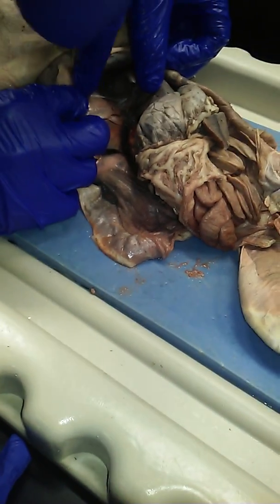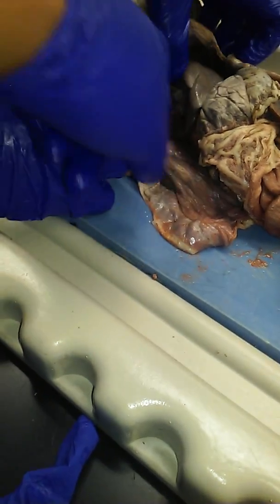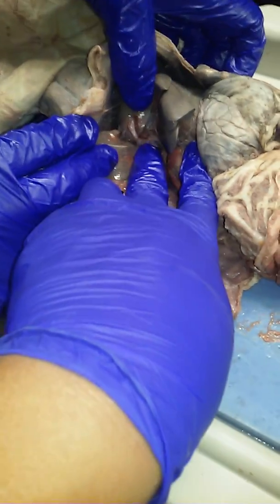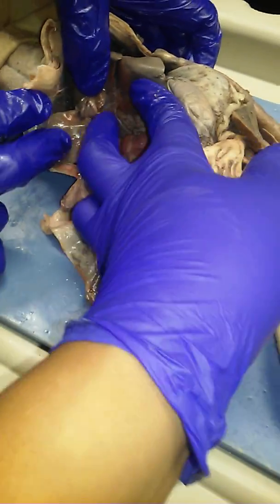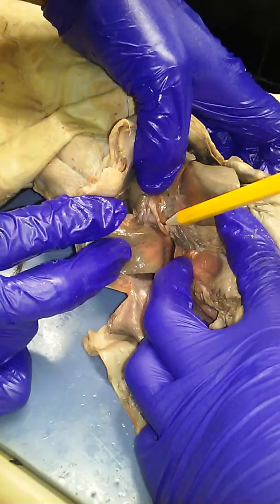Oh, wait. You can poke it with your finger. It's mostly inflated on that side. Open it right now. Oh, there it is. Right. Because the cat's dead, if you didn't know. Right there. We need our pointy thing. Right there. Here. Oh, that.